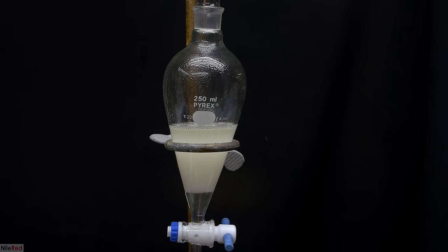Not too long after starting, we'll start to get some vapors coming over, and we want to maintain the temperature at around 75°C. We maintain the temperature here, because this is below the boiling point of isopropyl alcohol, but above that of acetone. The reaction is an equilibrium reaction, and by slowly removing the acetone, we push it towards completion.